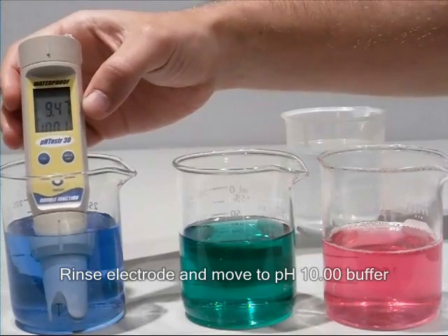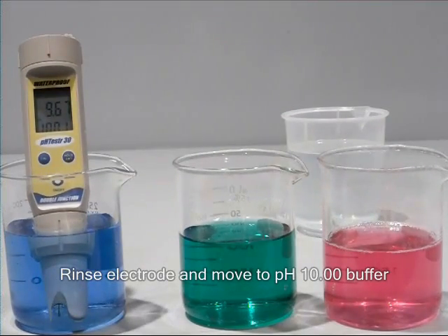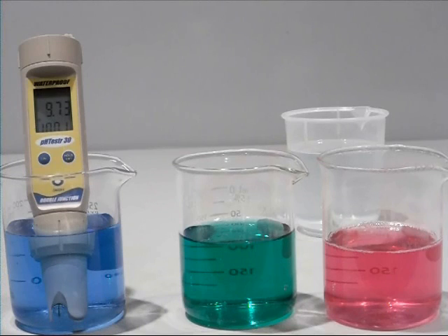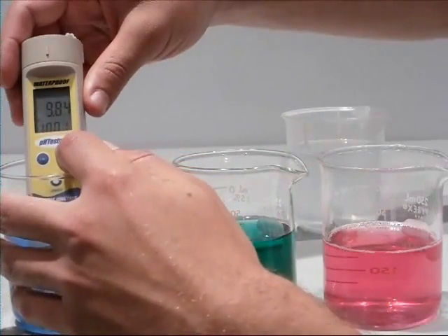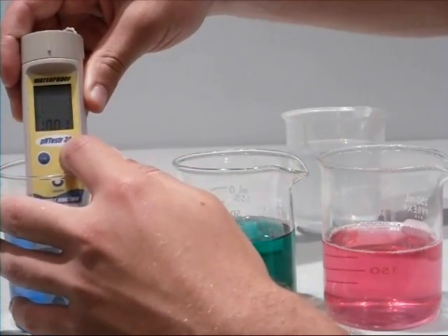Again, wait for the reading to stabilize, then press the HOLD ENTER key to confirm the final calibration point.